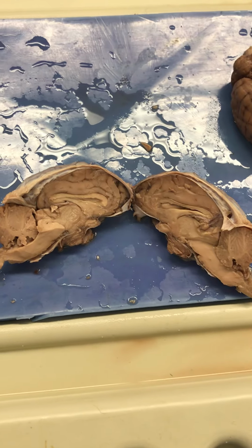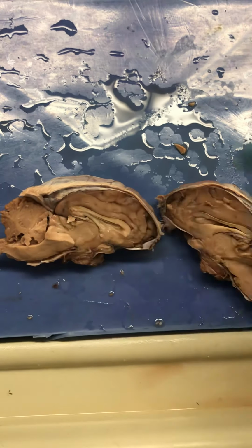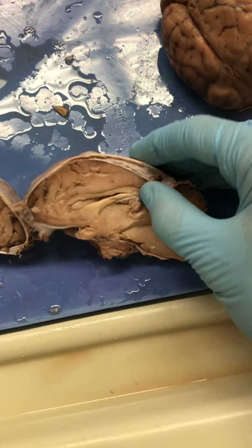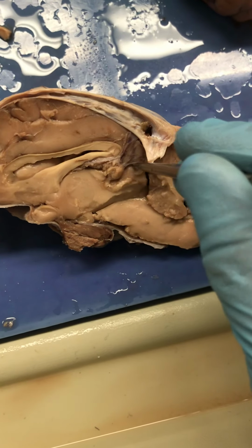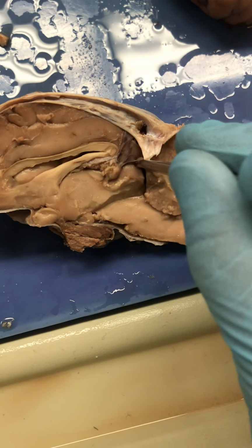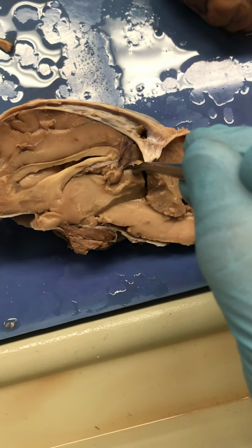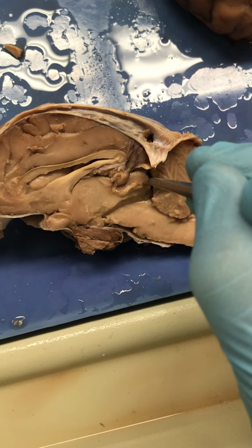posteriorly towards the end of the brain, we've got our midbrain here, which I've made so ugly. I'm so sorry. But if I move that flesh away, you see the brain is very delicate. This here, in the midbrain, is part of the Corpus Quadrigemina.